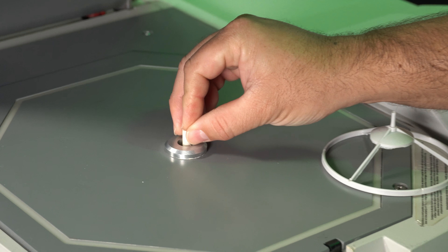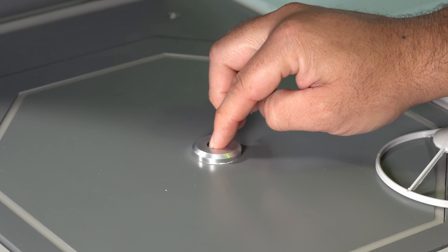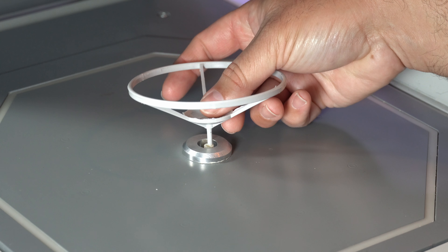To replace the stem, firmly push it down until it's stable. Finally, seat the balance pan back in place.